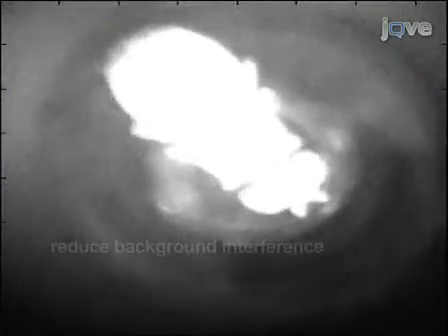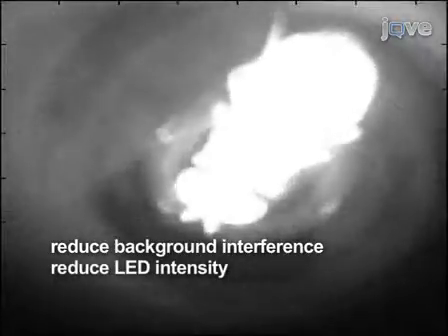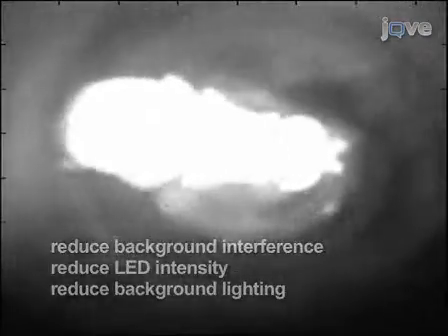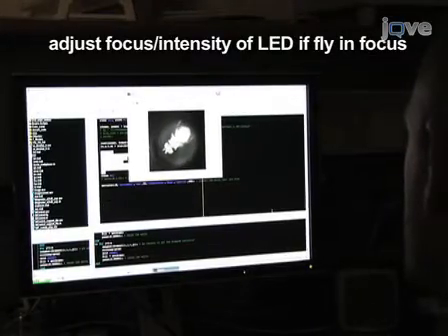When optimizing the OMT video image, remember that it should have a clear view of the illuminated fly on a dark black background. Overly bright images can be improved by reducing background interference, reducing the intensity of the infrared LEDs, or by turning off the room lights. If the fly is not properly illuminated, adjusting the focus of the infrared LEDs or modulating their intensity may fix the problem.